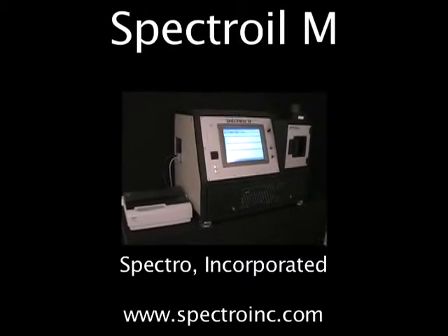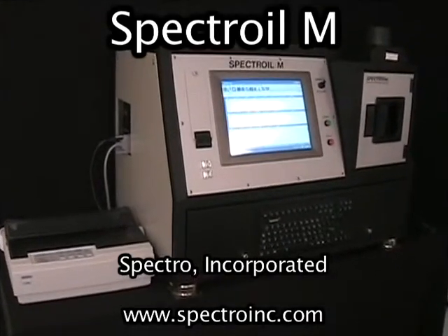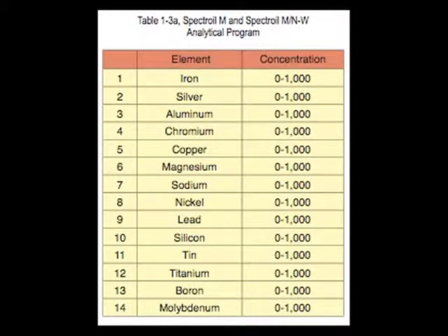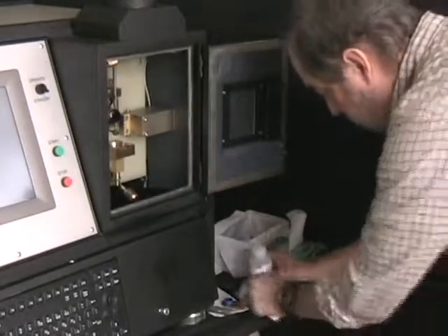Spectroil is a compact, rugged, transportable, and easy-to-use spectrometer designed specifically for the analysis of oil samples. It measures trace quantities of elements dissolved or suspended as fine particles in natural or synthetic petroleum-based products using the time-tested and reliable rotating disc electrode technique. The unit can also analyze fuels, water, coolants, and greases.